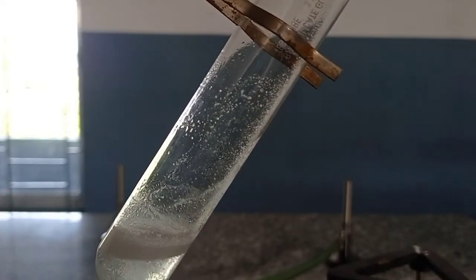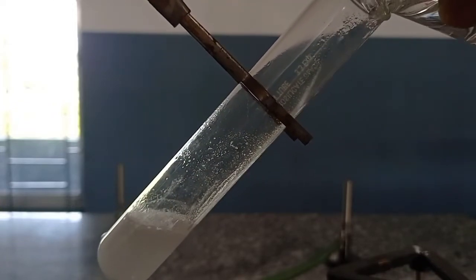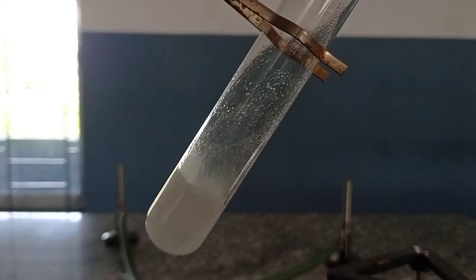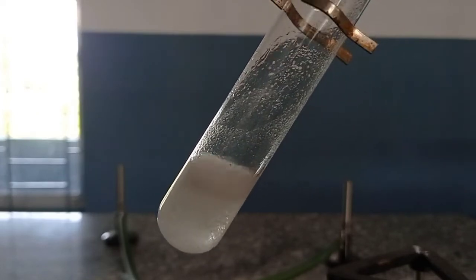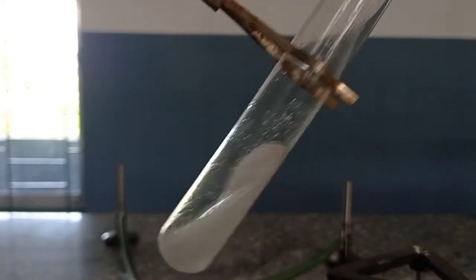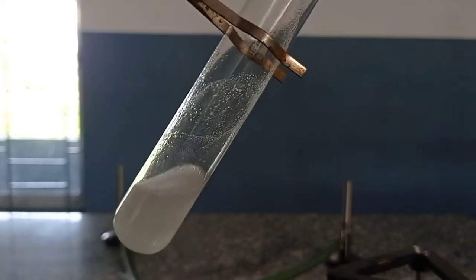If I want to get more effervescence, I have to add again a little more amount of acetic acid, and again you can see there is formation of effervescence. But this time it is not like before, because we have already used the salt and the carbon dioxide has already been liberated.